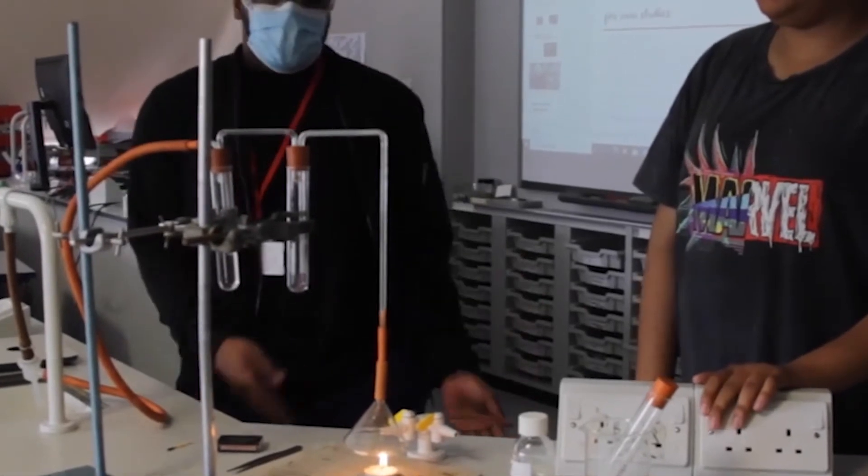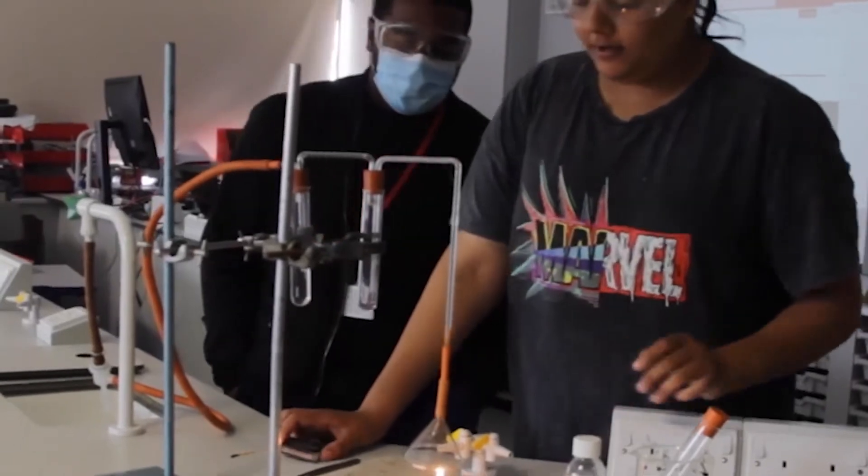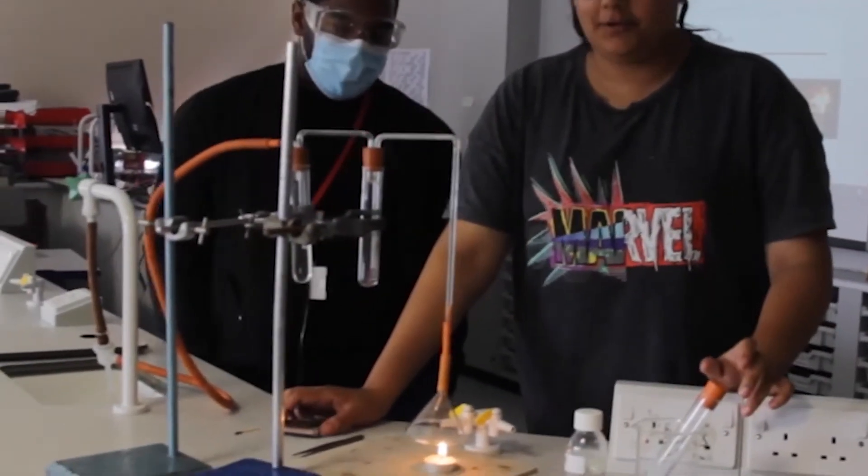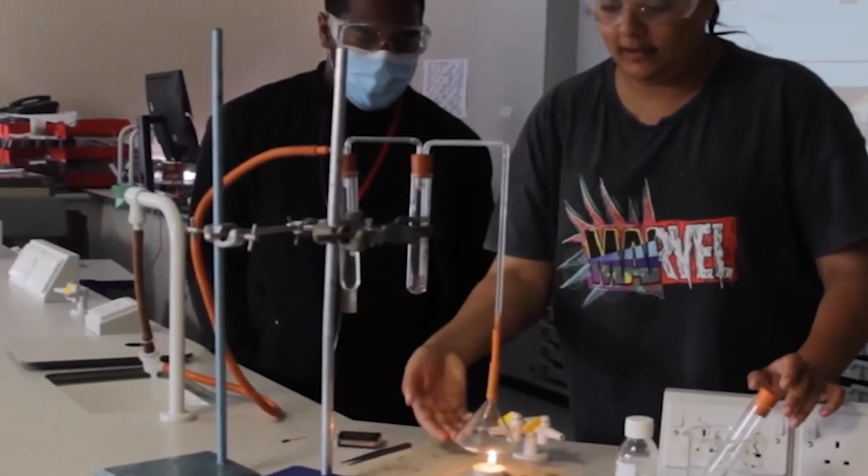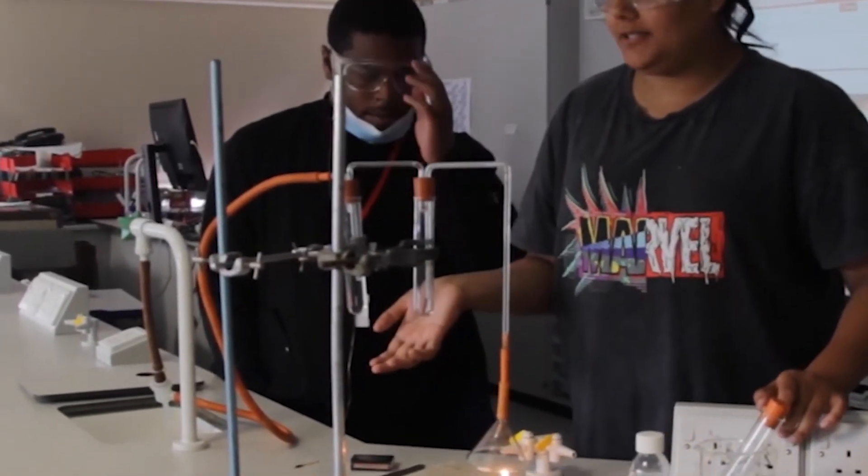My partner here will describe how this process works. Today we are trying to find the product that is in candle wax and figure out if there is water present and carbon dioxide present in the product.